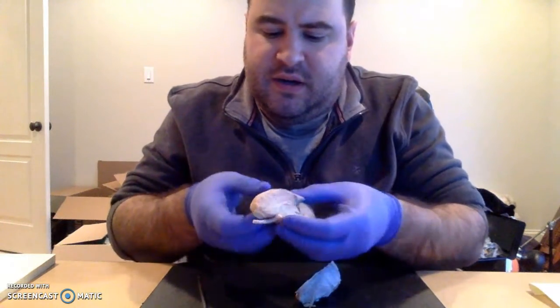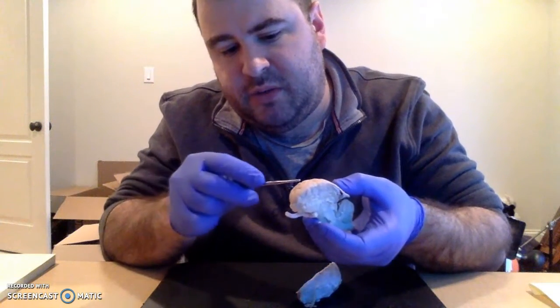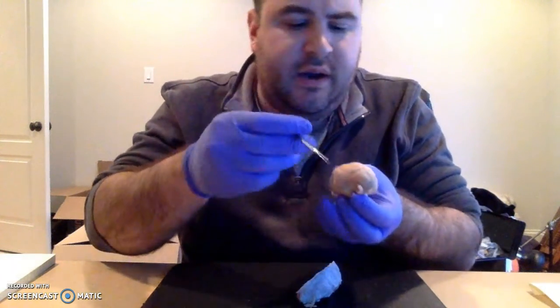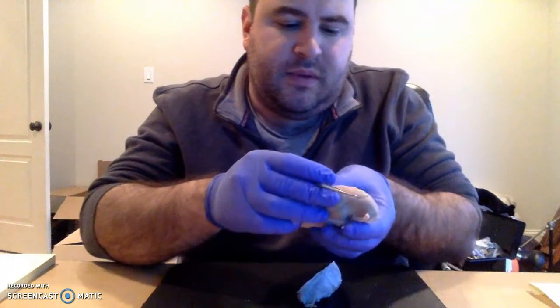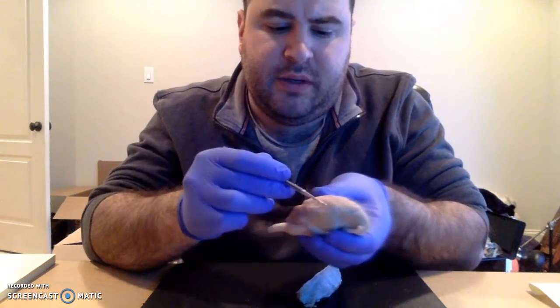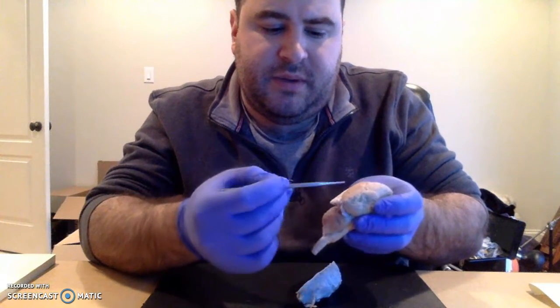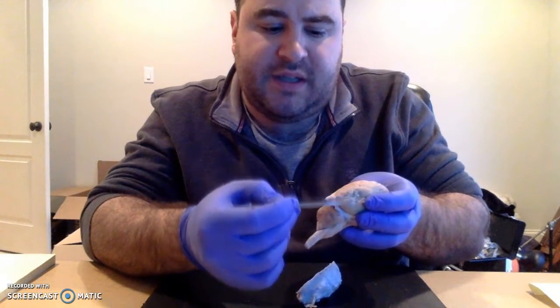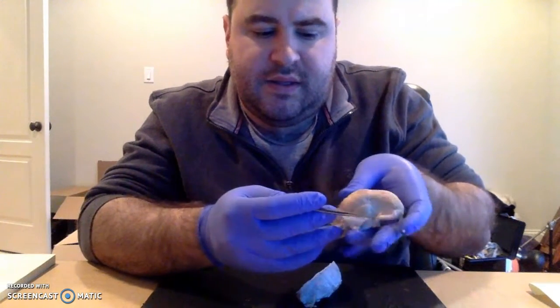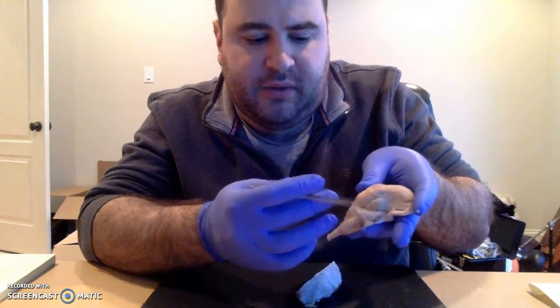We'll start with the lobes of the cerebrum. First up is the frontal lobe. That's going to be the most anterior lobe right there. Superior and posterior to that, we're going to have the parietal lobe. The posterior most lobe is the occipital lobe. And then this little outpouching on the lateral side, that's going to be the temporal lobe.